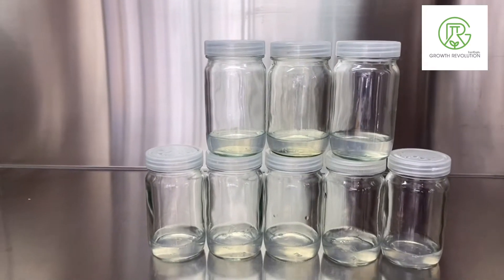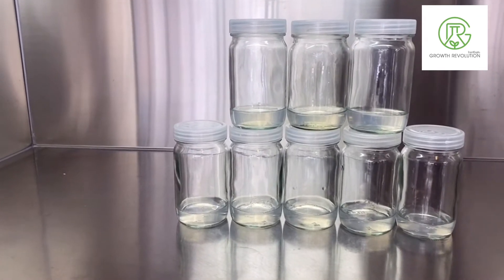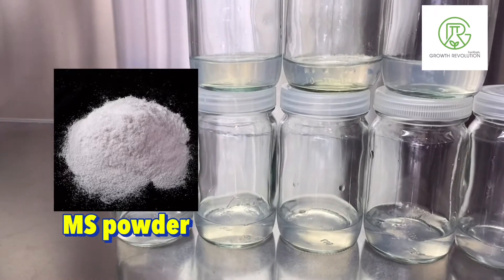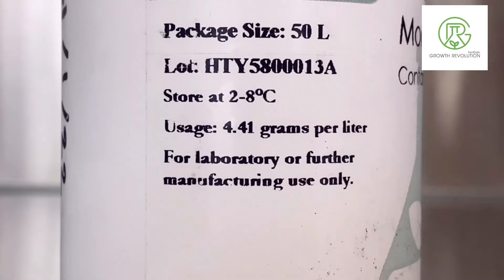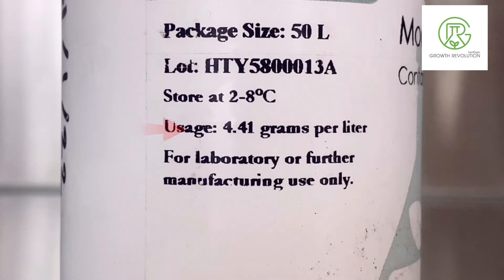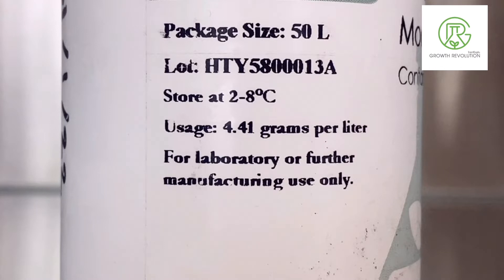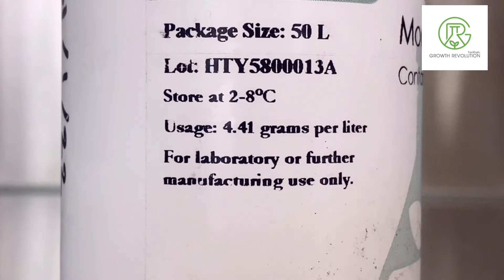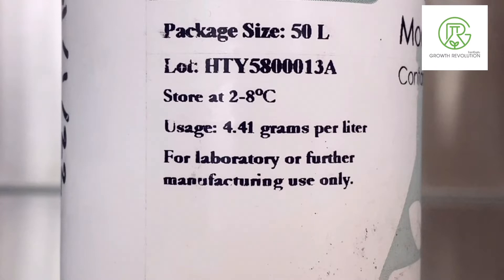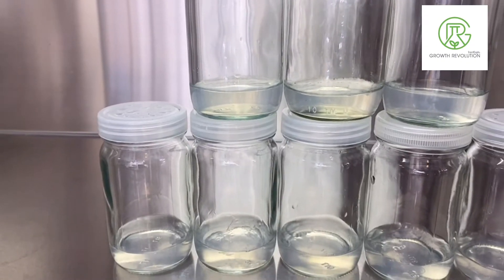Now I'm going to talk about it in more detail. First of all, we are going to prepare the MS powder. The one we are currently using requires 4.41 grams per liter, and that is the amount we are going to use. This depends on the brand — for this brand it is 4.41 grams per liter, but other brands may differ, so you have to follow the instructions on the label.